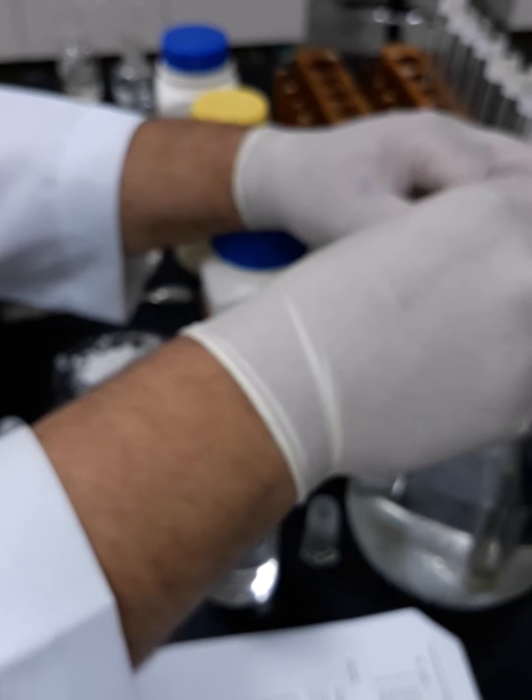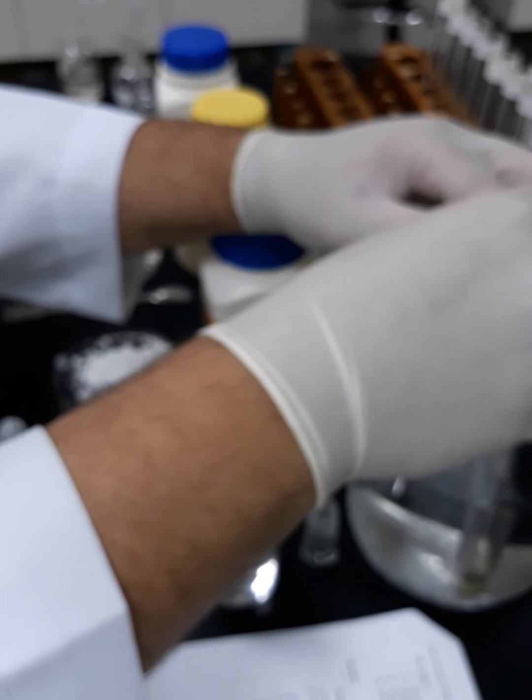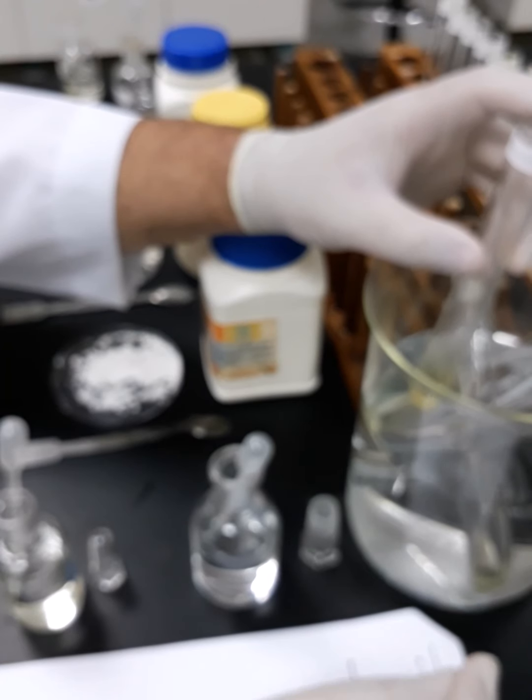It's too difficult to work inside, but I will do my best. Once again, there are only a few bubbles, but not as many as in tyrosine. So this is in paracetamol, but I cannot say that the amount of bubbles in para-aminobenzoic acid and in paracetamol is comparable with the tyrosine. With tyrosine, there was a huge amount of bubbles.